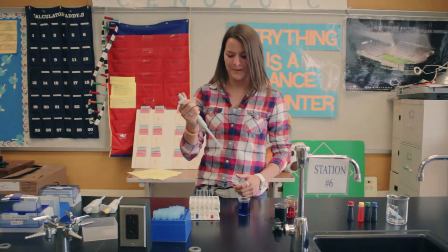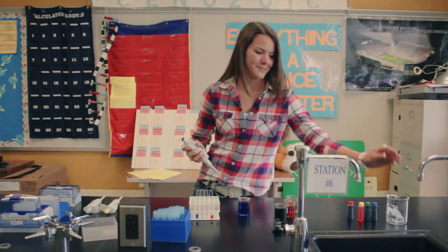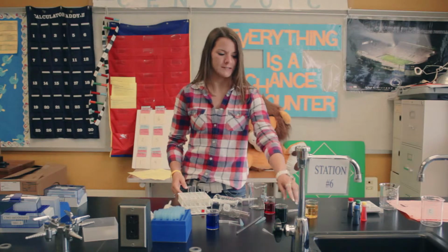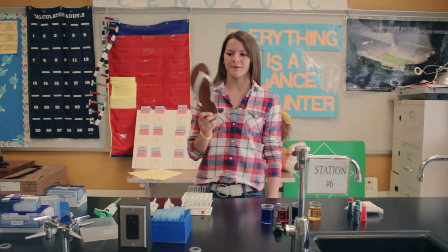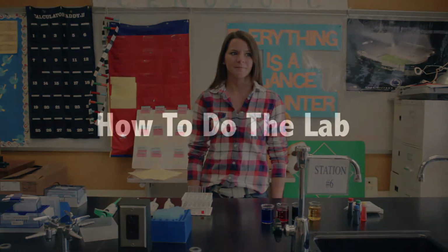Never play with lab equipment because you can always injure yourself or the micropipette. Do not leave stuff all over your lab table as you can injure yourself and tips can get contaminated. During labs, you do not want to use bad grammar, swear, or violate the dress code because Ms. Anselmina will yell at you. Whenever you're doing labs, you have to have proper shoes. Don't wear open-toed shoes. And if you have long sleeves, make sure you roll them up and pull your hair back.